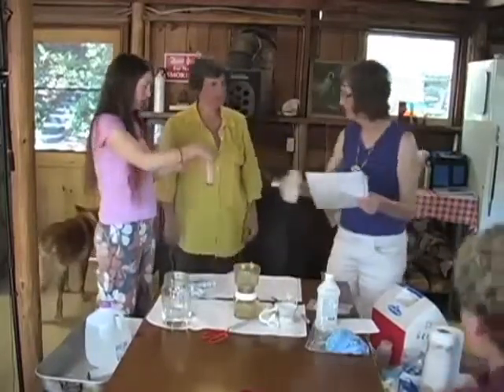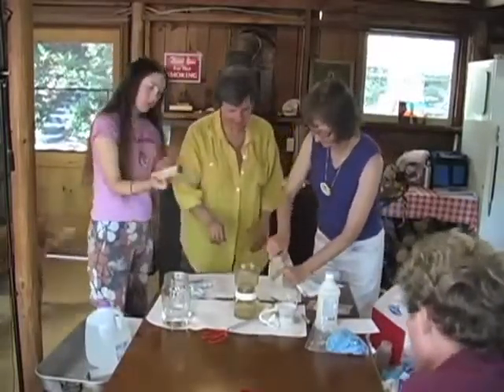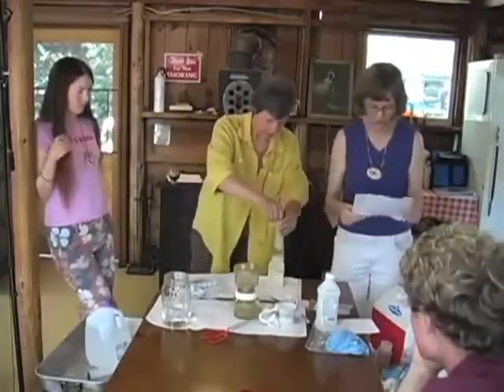Okay, we shook the sample bottle out. You're going to draw our sample for us? Sure. All right. How many cc's? Up to 50. Okay. Now, we could do 100, but it just takes, yeah, we don't know.